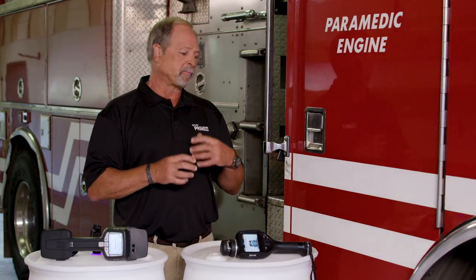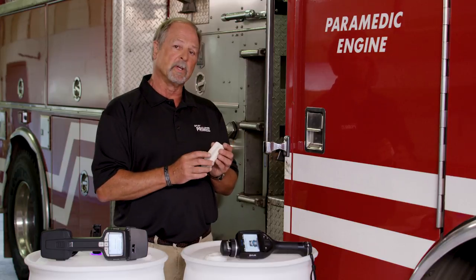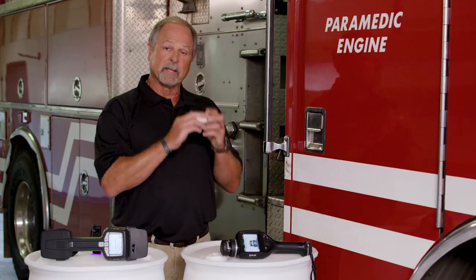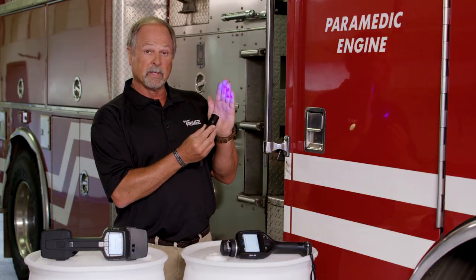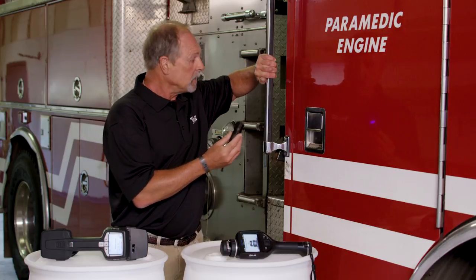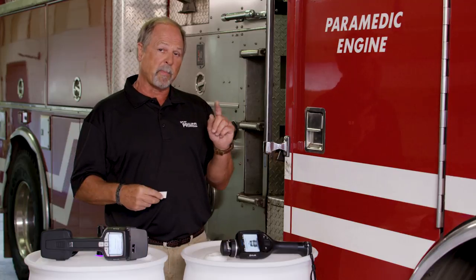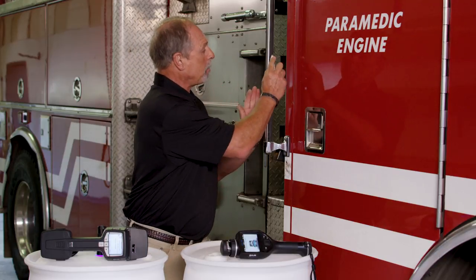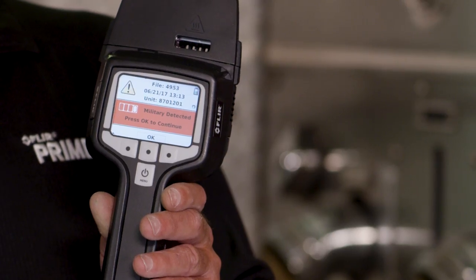Let's look at sampling at the scene of a homemade explosives lab, where you have precursor chemicals or finished product. These can be sampled at remote sites because contamination can be transferred in minute quantities you can't even see. An explosives maker handling material in the lab will transfer contamination to their hands. As they walk away and touch doors and handles, that contamination is transferred away from the site. In quantities you can't see, but with proper technique, you can swab the hands of a suspect or swab a door handle or knob, place it in the detector, and actually pick up those chemicals.